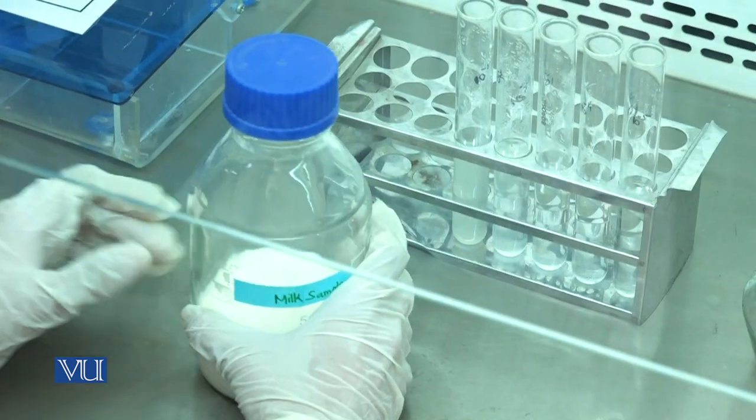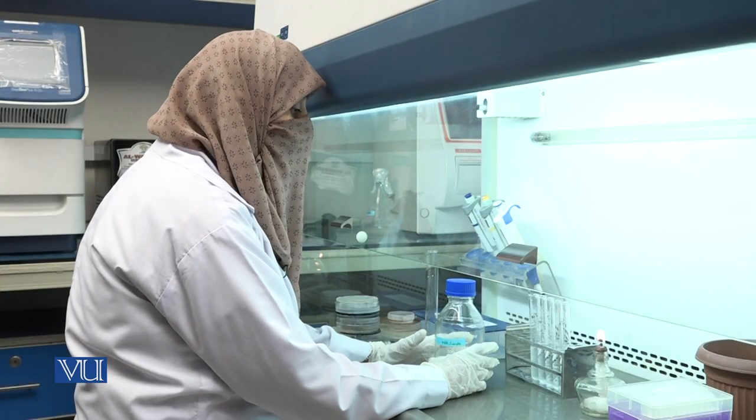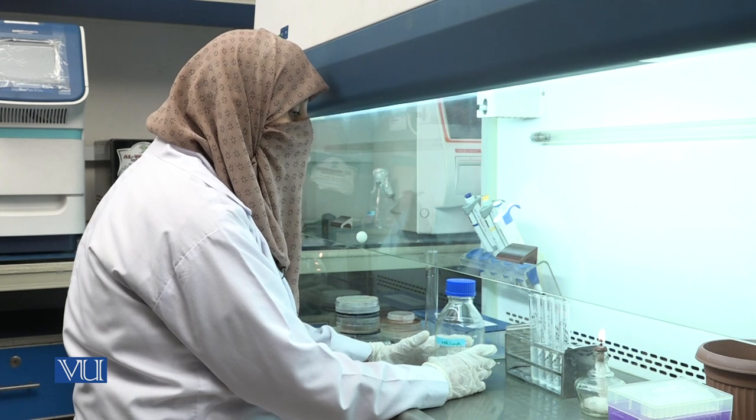After pasteurization, cool the milk sample to 37 degrees centigrade.